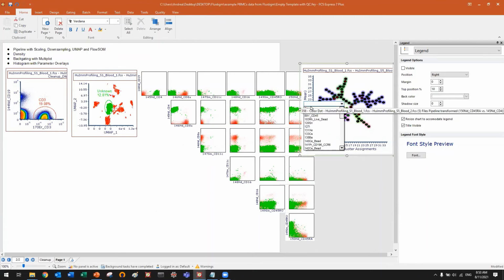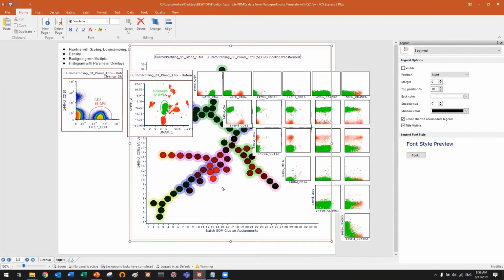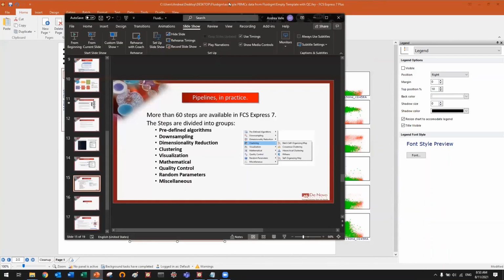Also in FlowSOM, you see, I can color each, let me do it like CD8. You see, I can color each node of the FlowSOM tree based on the expression of a given marker. So now I know that at the bottom left, I have some red nodes for CD8. Okay, so let me go back here.